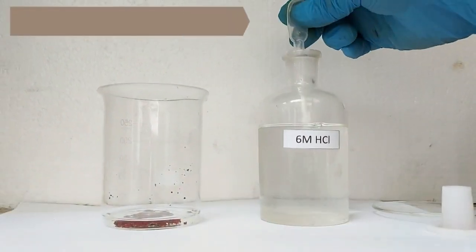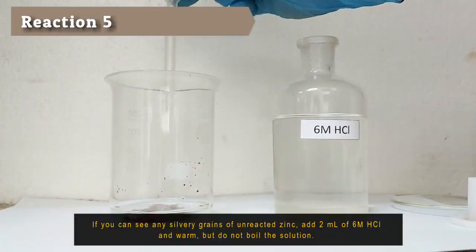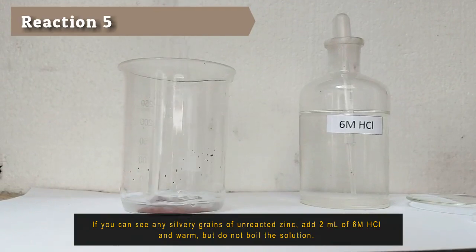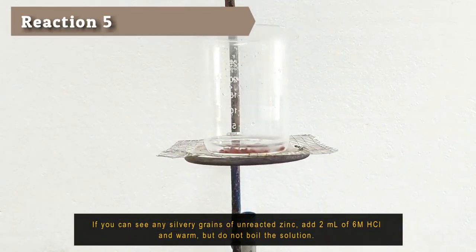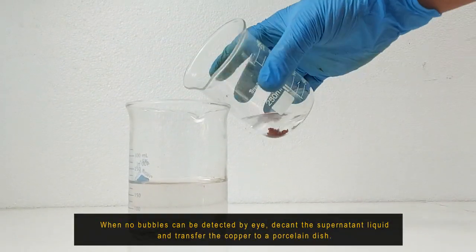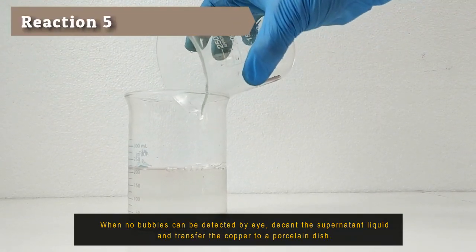Decant the supernatant liquid, being careful not to lose any copper. If you can see any silvery grains of unreacted zinc, add 2 ml of 6 molarity hydrochloric acid and warm, but do not boil the solution. When no bubbles can be detected by the eye, decant the supernatant liquid and transfer the copper to a porcelain dish.